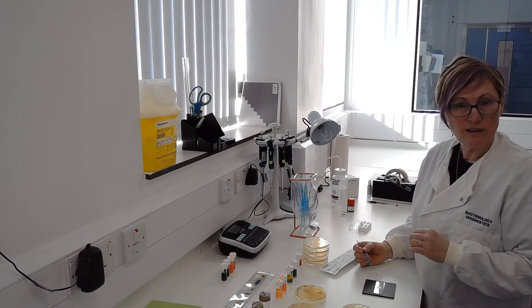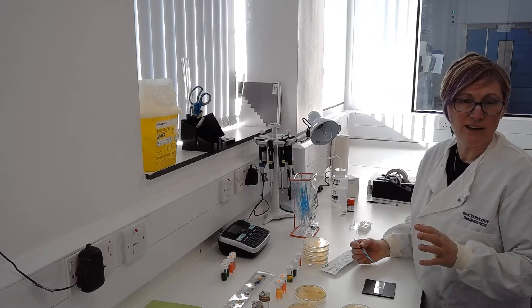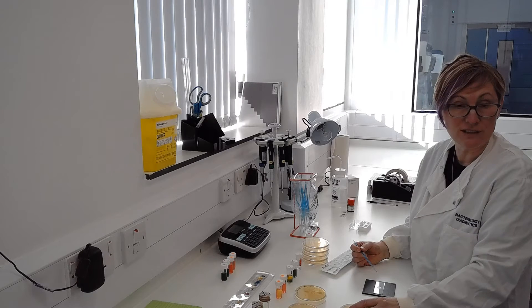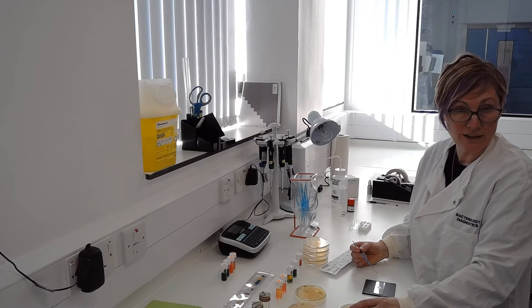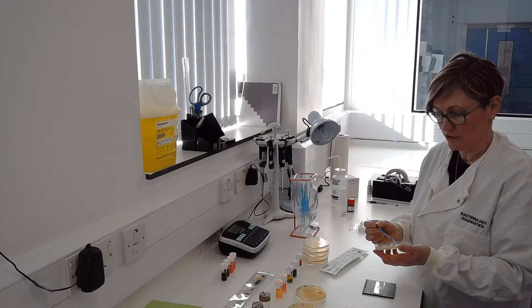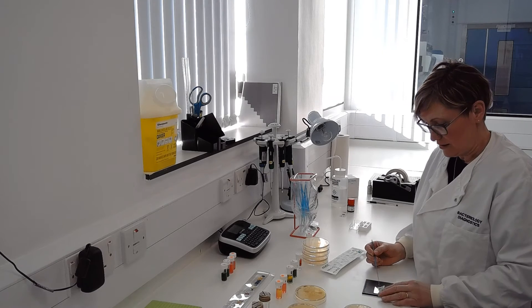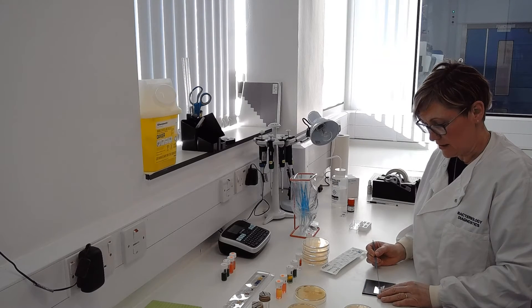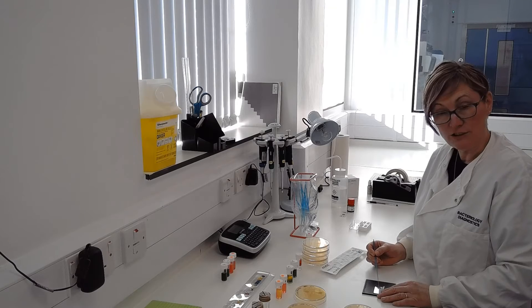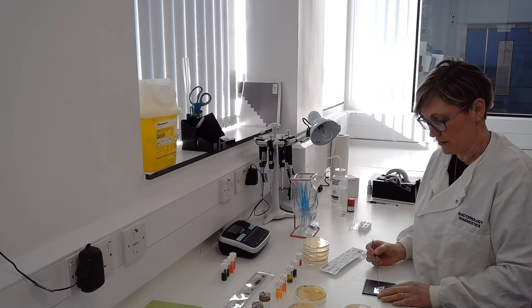The motility one we look at straight away, and we'll add in some pictures and videos so that you can see what they look like down the microscope. A little bit of my colony mixed into the liquid and spread on the slide so that I can have a proper look when it's under the microscope.